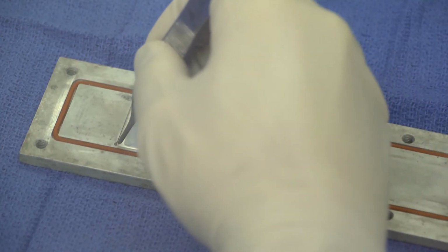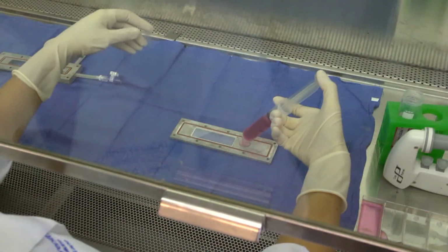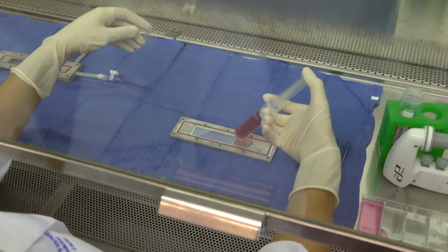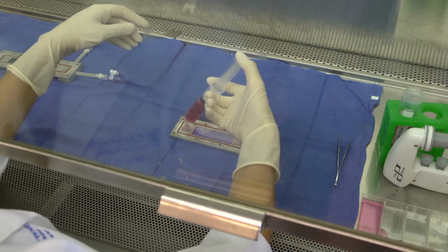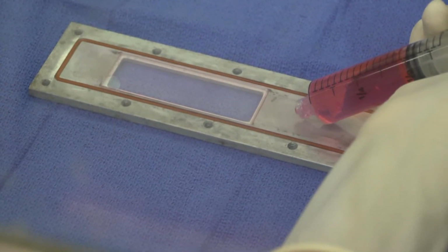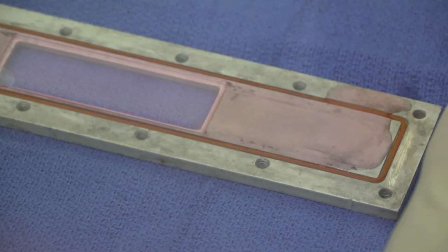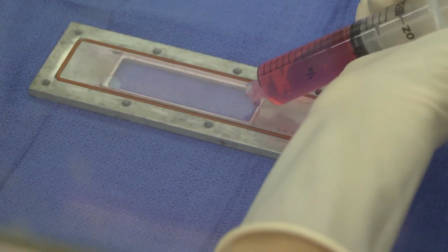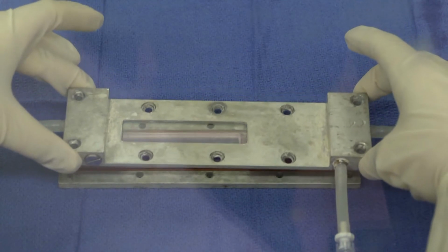Make sure that the slide is placed with the cell-seeded side facing up. Using a syringe or pipette, place 10 milliliters of warm EPC medium over the cell-seeded slide. Allow the medium to cover the slide and flow chamber, but do not spill the medium over the O-ring on the bottom plate. Place the top plate of the flow chamber onto the bottom plate, aligning the screw holes.